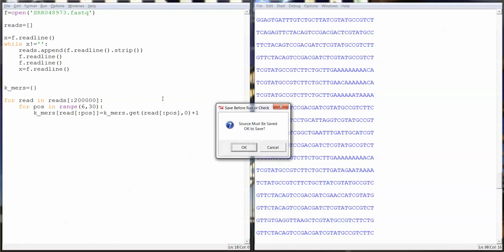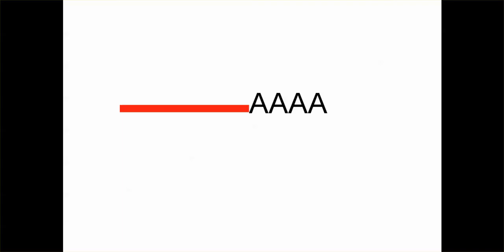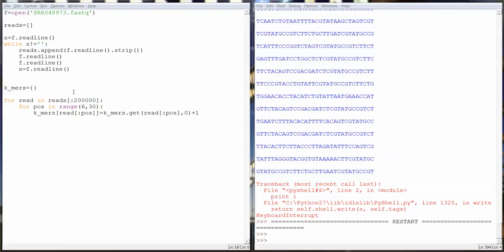So this is going to take a second to run. Let's see how long that takes. Just to show you what we're doing, we don't know how far to go into the read, so we're taking these slices and we're going up to position 30. If the adapter is longer than position 30, then we'll have to alter our code here. So it looks like we're done.